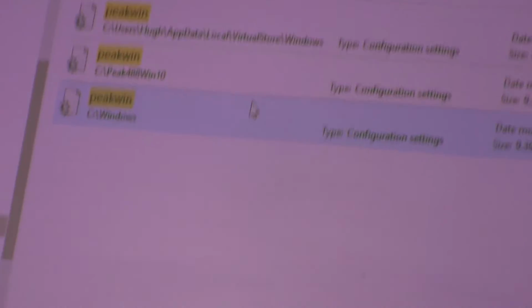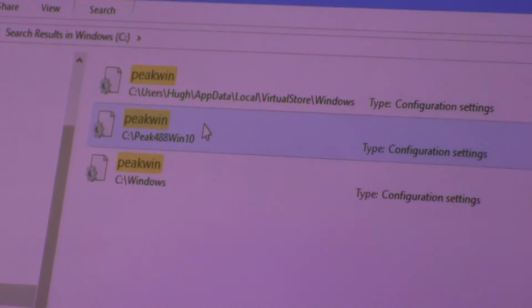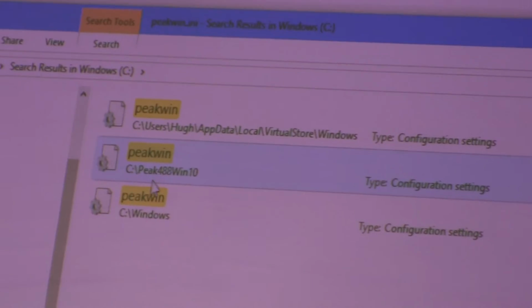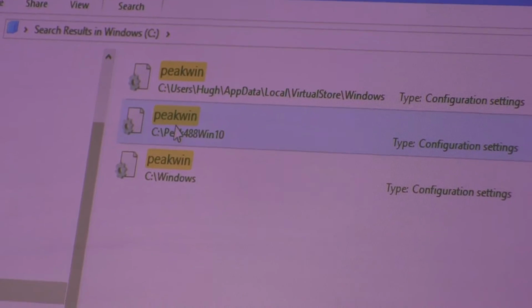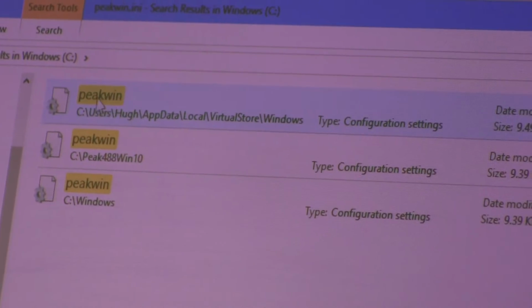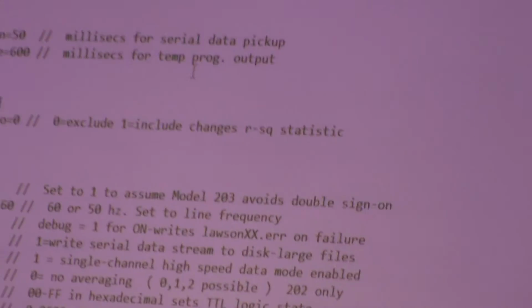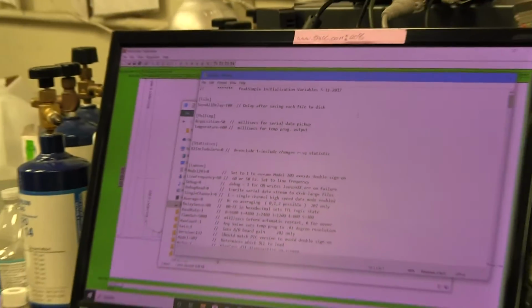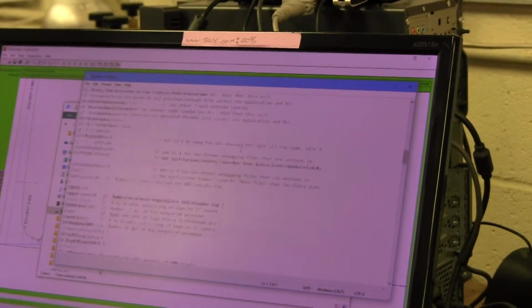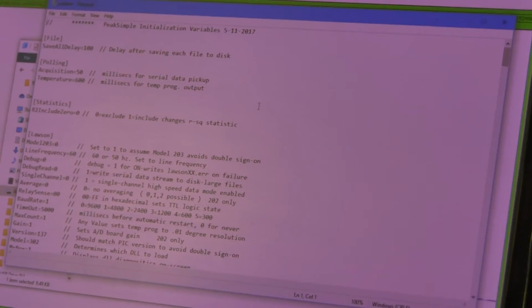Yeah, found one more copy, and that would be in the PeakSimple folder that you created when you ran the installation program. You would have created this folder, C:\peak488. So there's probably multiple copies of this file, but the one that counts is this. So if we double click on the one that counts, it takes us and we can look at the file. So this is what the file should look like. It's got a lot of text in there. It tells PeakSimple all the things to do at the very beginning when it first launches.